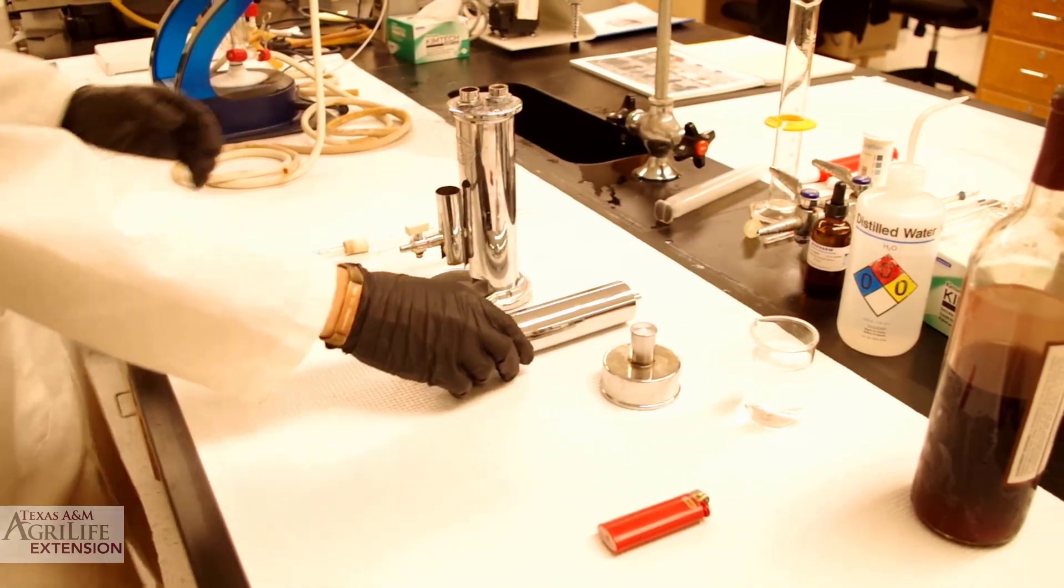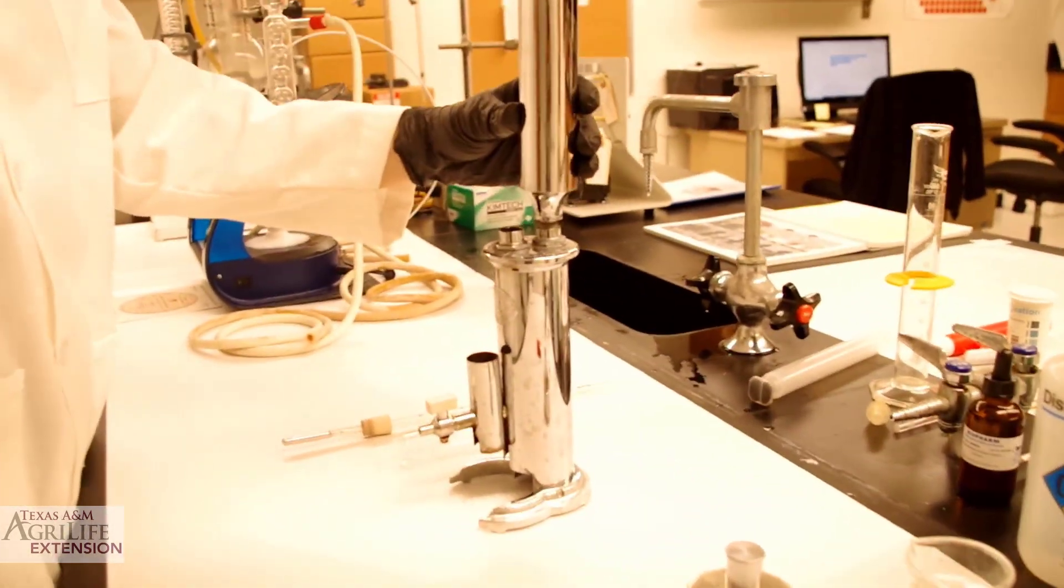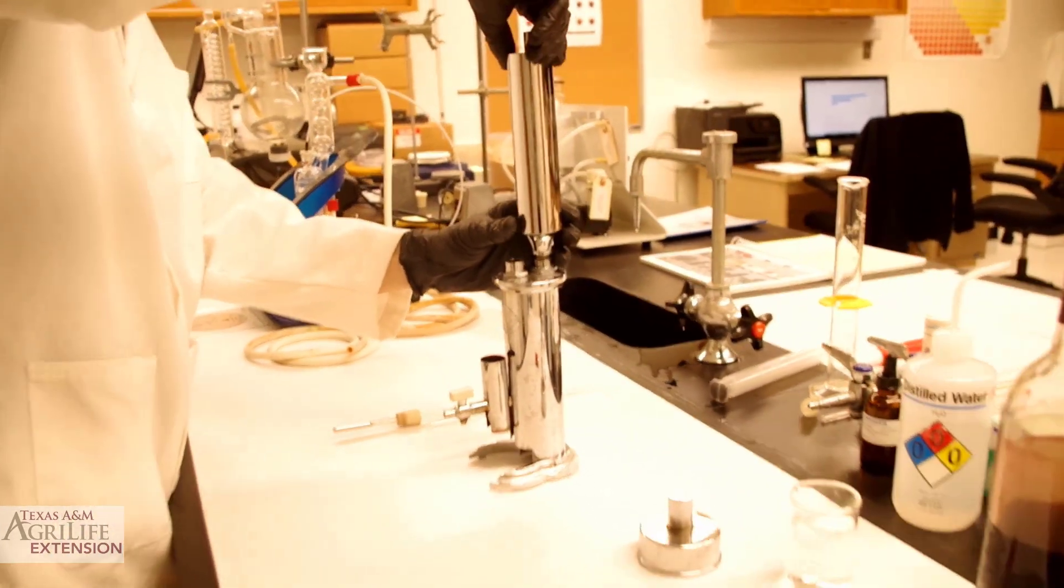Let's start by setting it up. We connect the cooling chamber to the boiling chamber first.